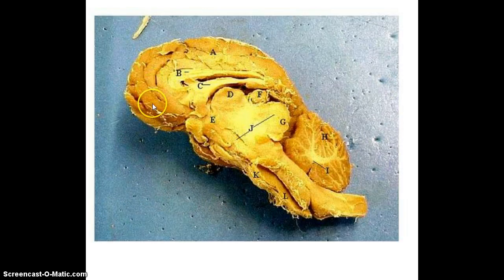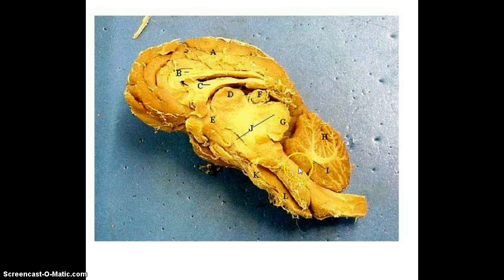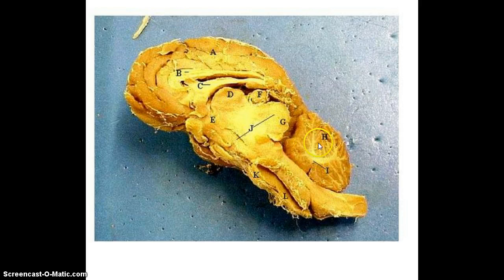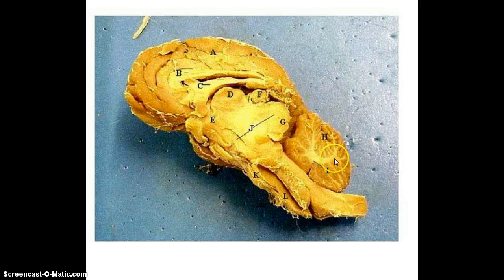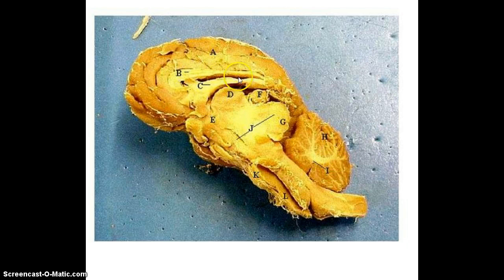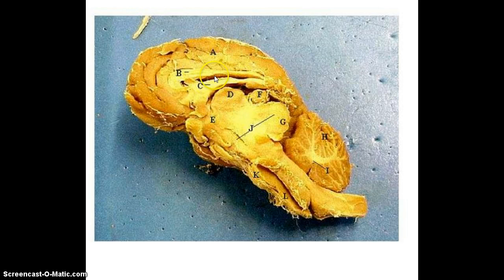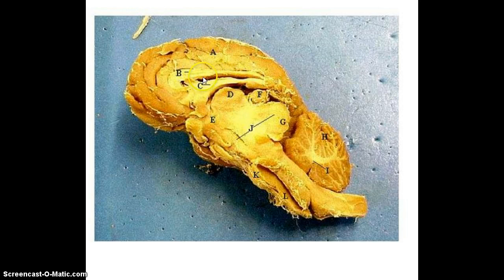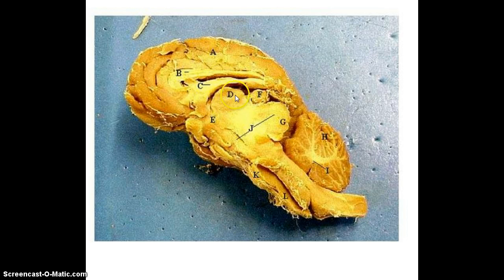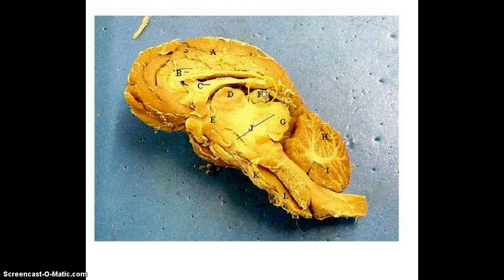I'm going to go through these. This whole structure here is the cerebrum. This structure down here, posterior, is the cerebellum. This tree-like pattern you see is the arborvitae. Here is the corpus callosum. This space in here is the lateral ventricle — when you're doing the dissection, you may have to put a blunt probe in there to see that space, because that's where cerebral spinal fluid is going to flow. Below that is the fornix. This is the thalamus, hypothalamus, and pineal gland.